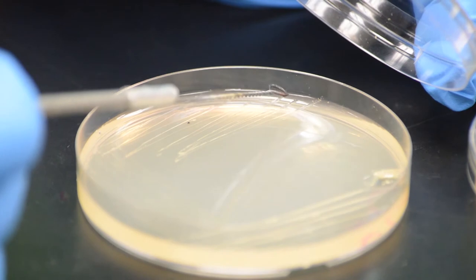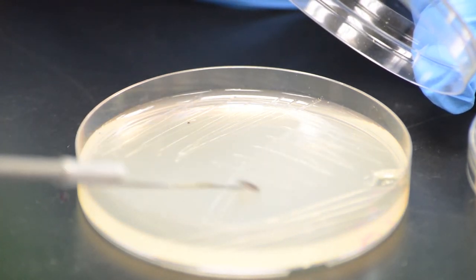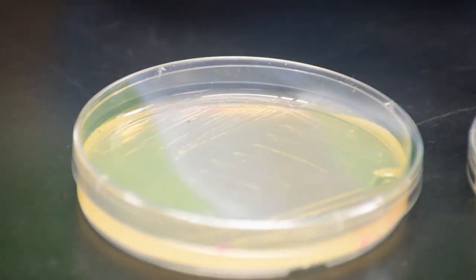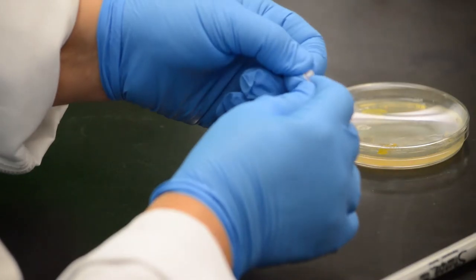Remember, your goal is to dilute the billions of cells of bacteria down to one CFU—one colony forming unit—in order to obtain individual isolated colonies. Look at the picture when your streak plate is finished.